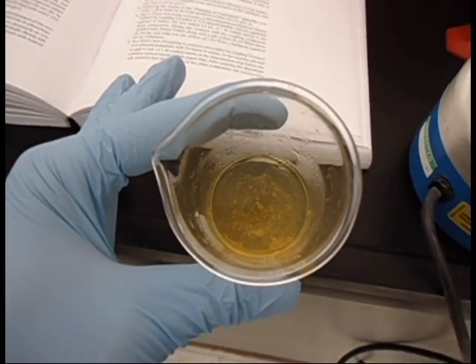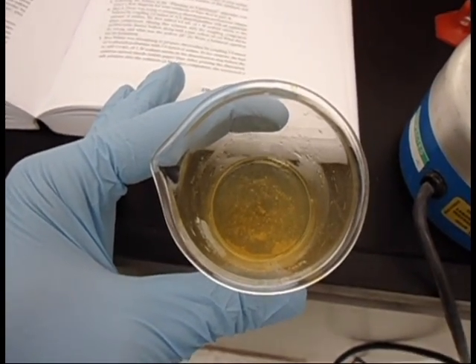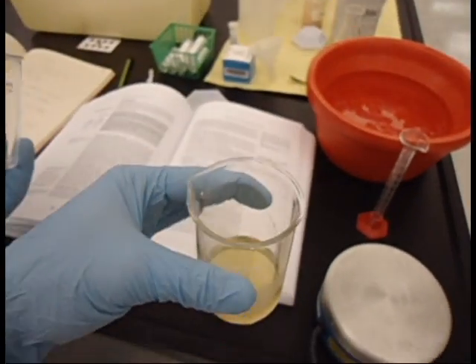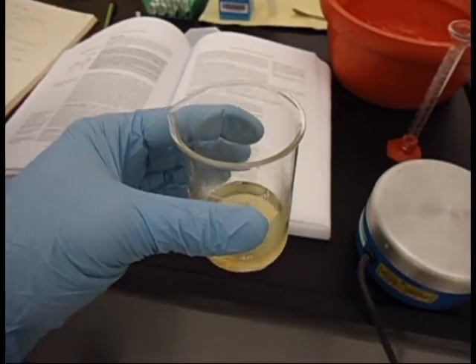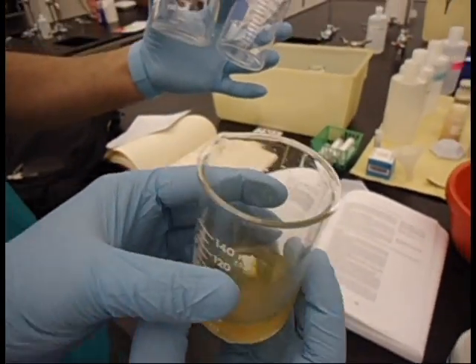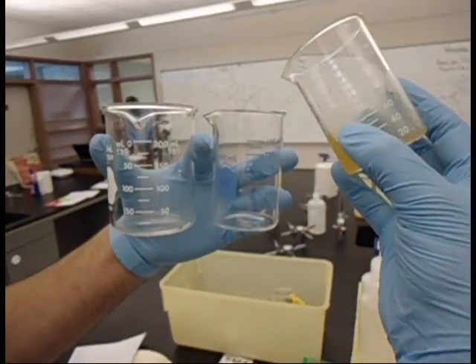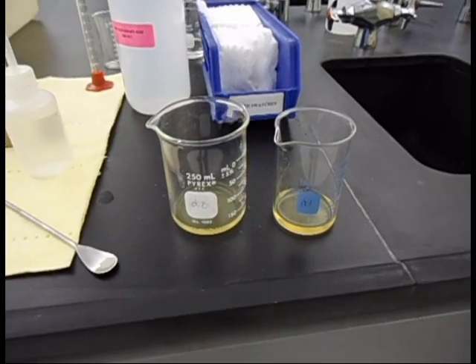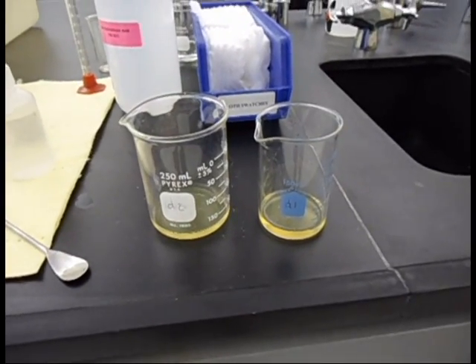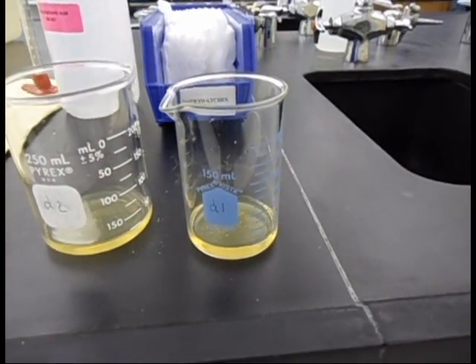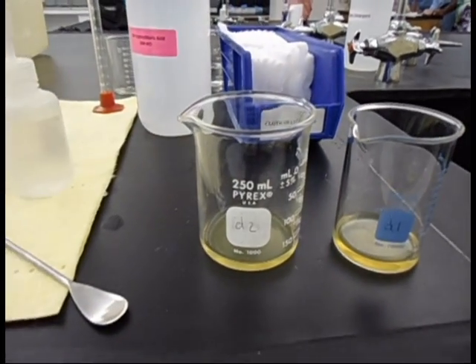As you can see, we've got a little bit of precipitate forming in the mixture. The next step, we're going to be separating this into two equal parts. We've separated the mixture into two equal parts, one labeled D1 and one labeled D2.